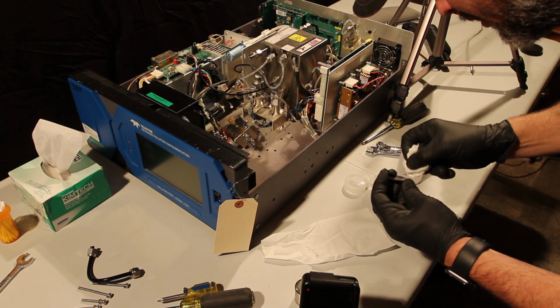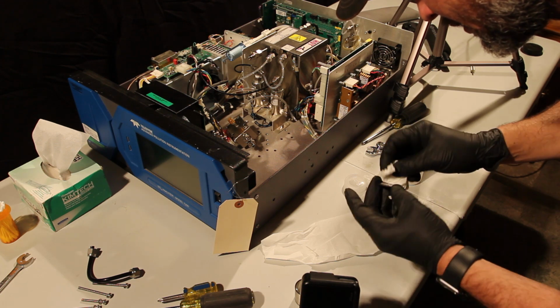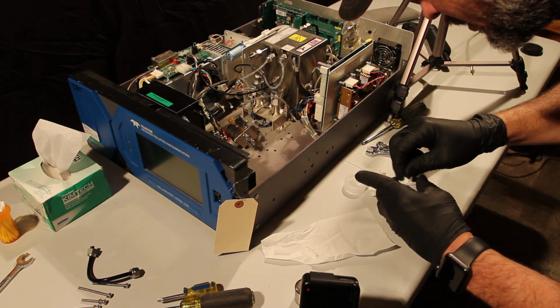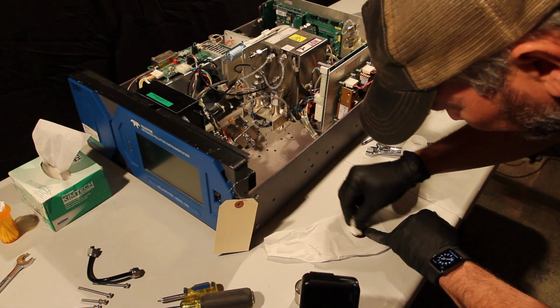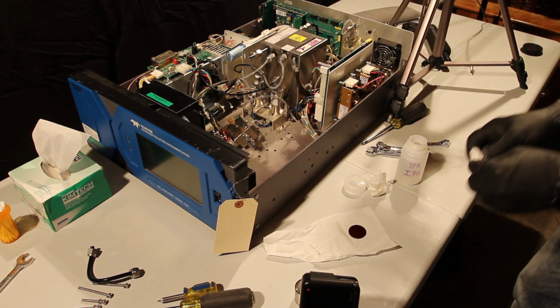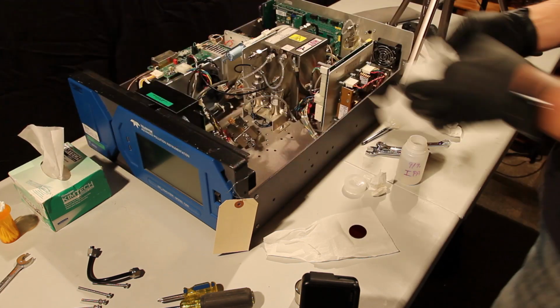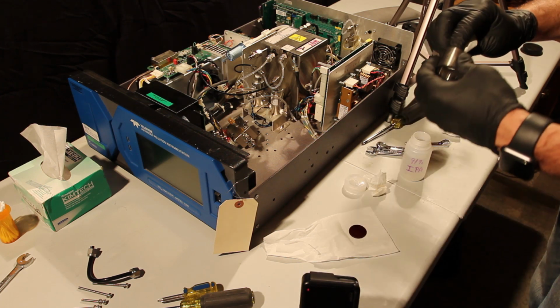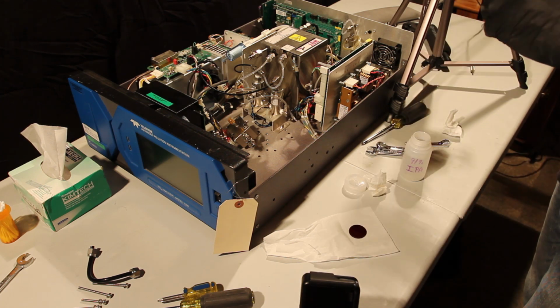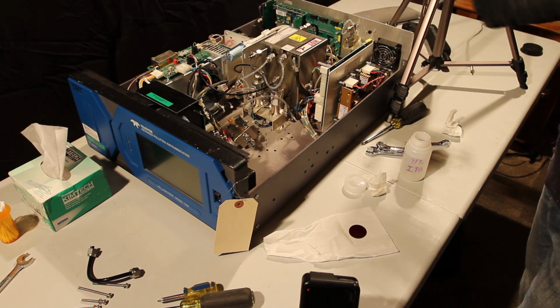Pretty clean smudge there. A little dust on it, but that'll be alright. Get that off there. Have some canned air to get that last little bit of dust off. So we've got that clean. Grab another little bit of alcohol. We want to clean out this chamber. And see how much black stuff's coming out of there. Some of that's coming off the O-ring, but this one was very dirty.